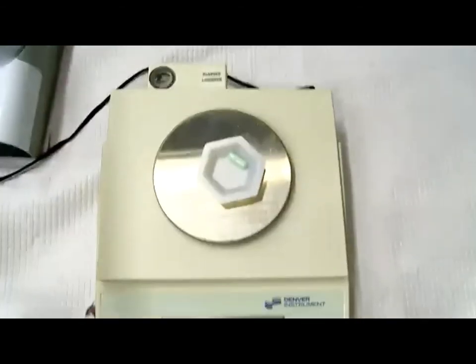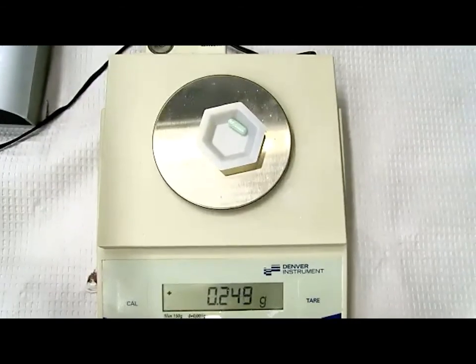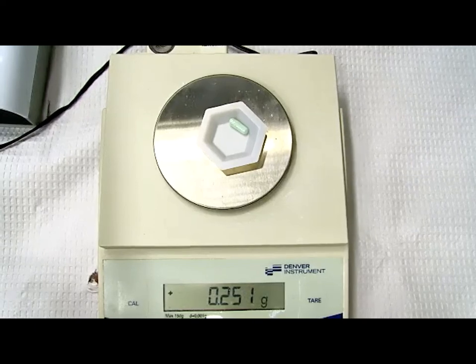This would be our actual QA weight. So everyone, let's write down 250 milligrams. We got a spot, Judy, for that. That was right around 250 milligrams. Again, you don't have to say capsule number 1 because we'll never know which capsule was which, but we're going to write each individual capsule weight. So 250 milligrams for the first capsule.